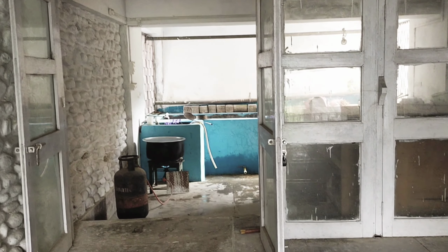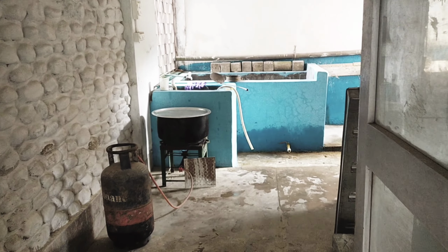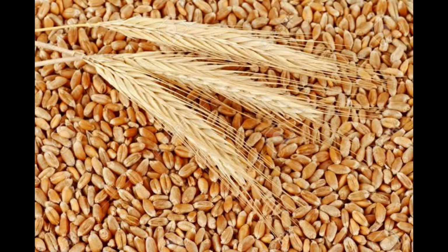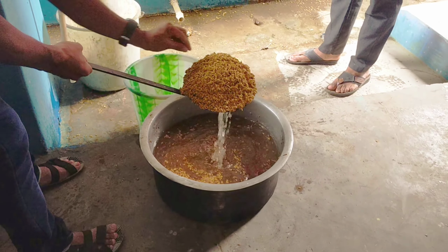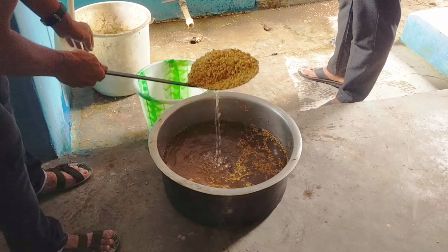Welcome to the first episode of Life in the Laboratory, and this episode is all about production of mushroom spawn. Cereal grains like wheat, millet, rice, etc. can be used as a substrate for making spawn, but in Arunachal Pradesh, rice grain is mostly used as a substrate for the production of spawn, and today we'll be making spawn using grains.